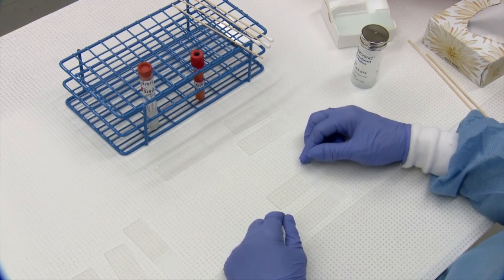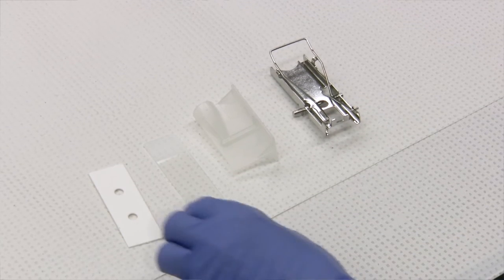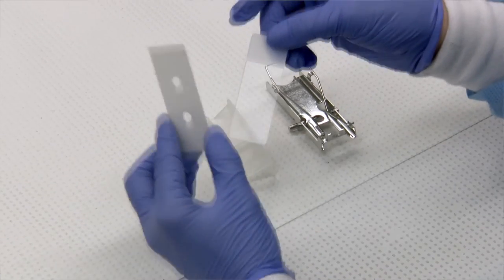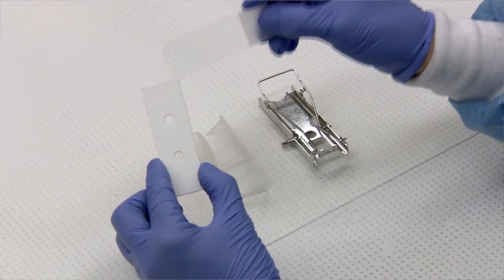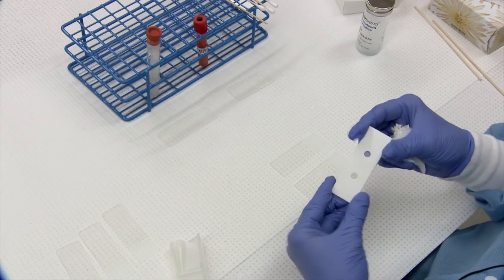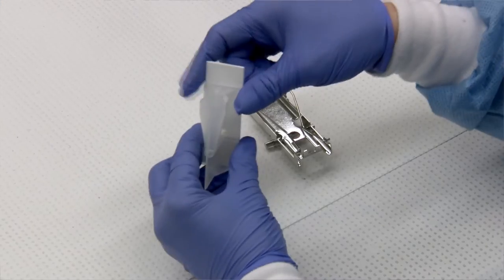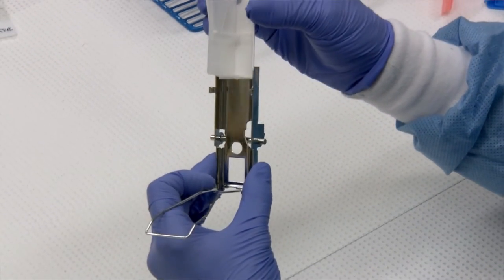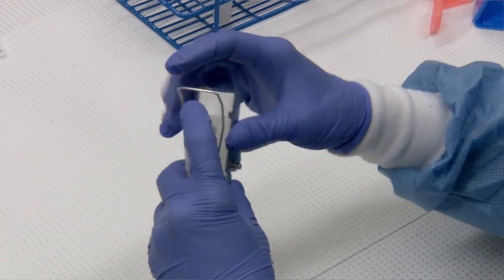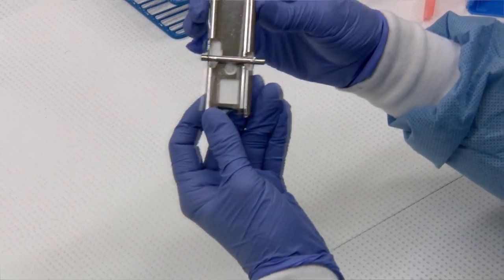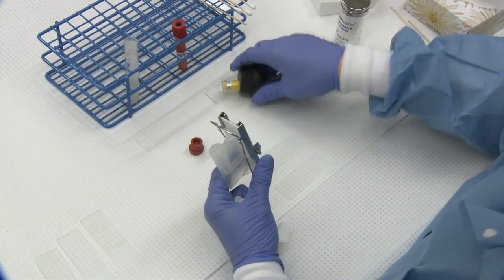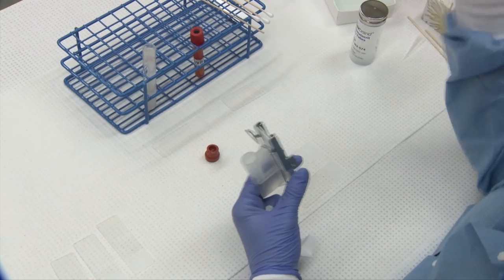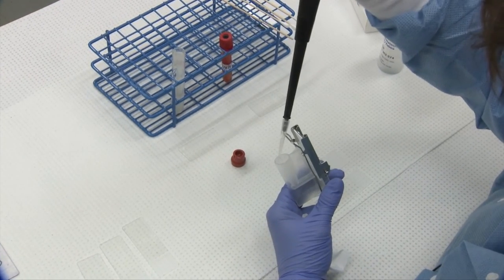To make a concentrated sample, which we do on all fluids that we get in the lab, we have what's called a cytospin centrifuge. It's a combination apparatus of a slide, a filter paper on which there are two sides, a more absorbent side and a flat side. The more absorbent side goes up. The cup goes on top of that and then fits into a clip. And you want to ensure that all of your holes line up. You'll load your cytospin apparatus with approximately 200 microliters of sample. If it is extremely cloudy, you will want to dilute it with some saline until you can barely see through it. Otherwise, the button is too thick for our pathologist to read the cells.